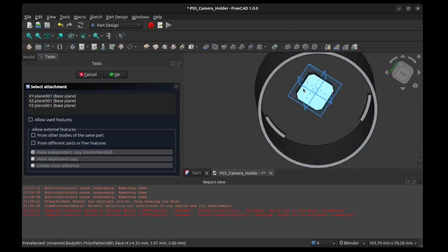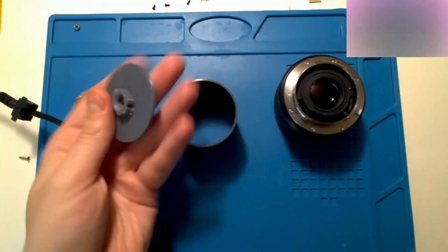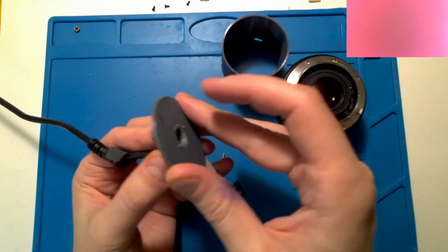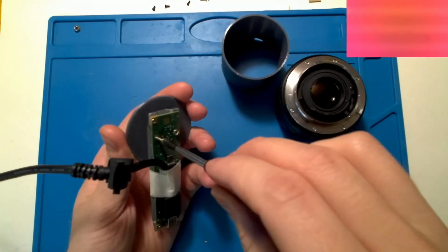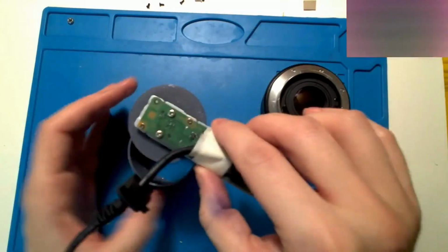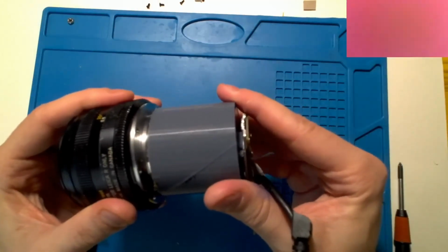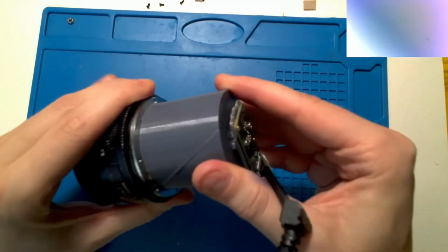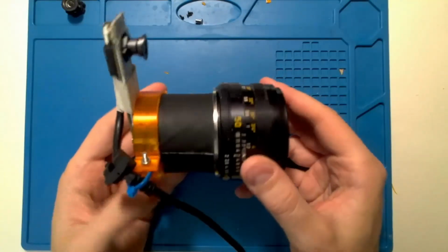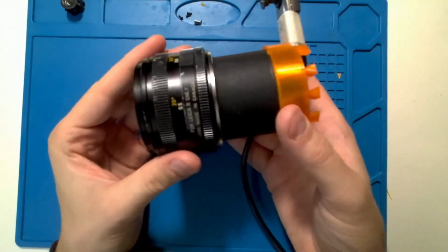and with this information I started sketching out a rudimentary holder within FreeCAD. We have to make sure that no light enters into the sensor other than from the lens directly, or else we might get a milky picture. And I copied the design of the original lens holder and extended the barrel around it. The size of the barrel is basically just the size of the lens mount, and at the end of the barrel I made the bayonet connector matching up with the lens.